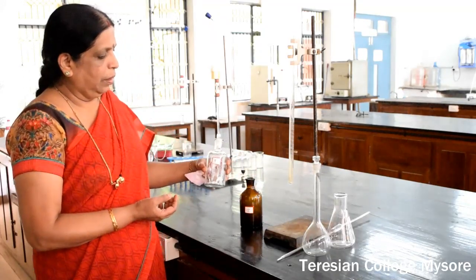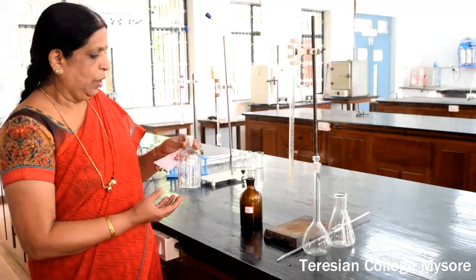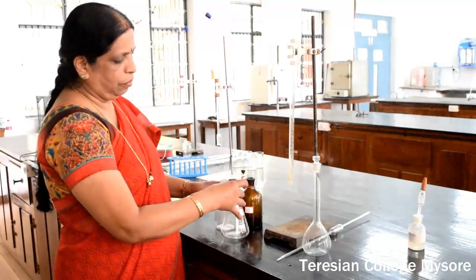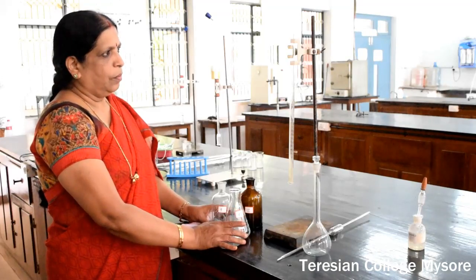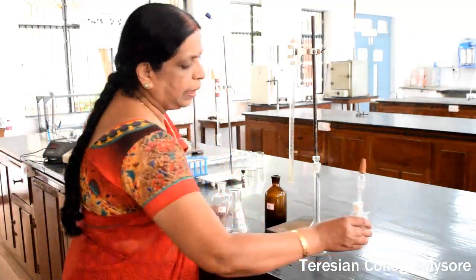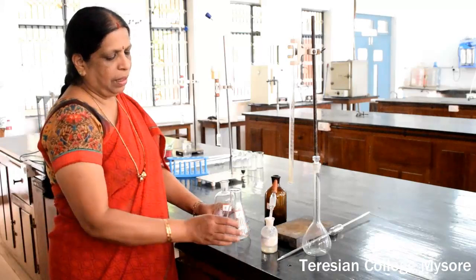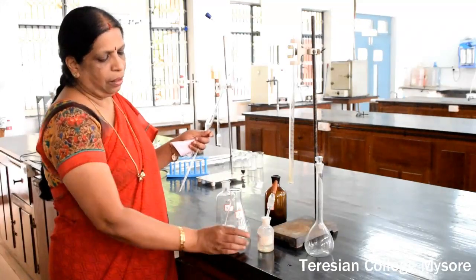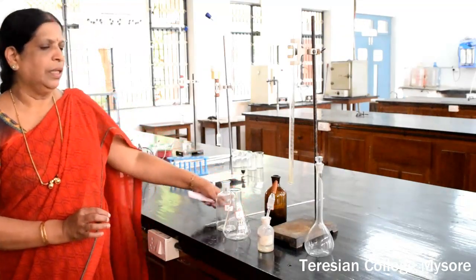In the other colorless bottle, for estimation of carboxylic acid, oxalic acid whose normality is 0.1 N is given to you. First, pipette out 25 cc of oxalic acid into a 250 ml flask. Fill the burette with the sodium hydroxide that is supplied to you. And then, using phenolphthalein indicator — it is a simple acid-base titration — after pipetting 25 ml of oxalic acid into the flask, add 2 to 3 drops of phenolphthalein indicator.